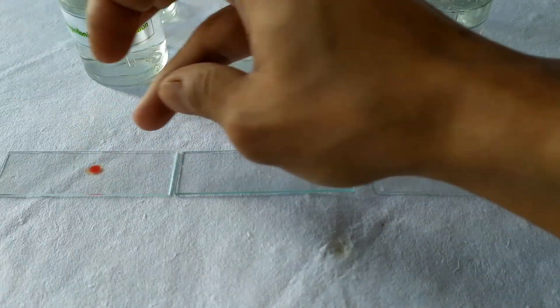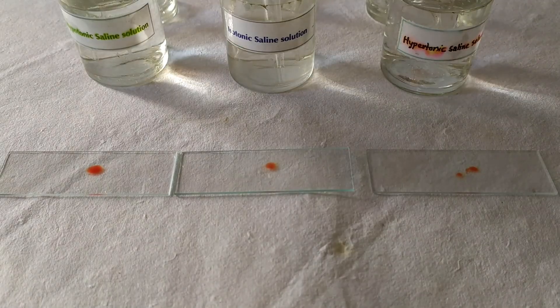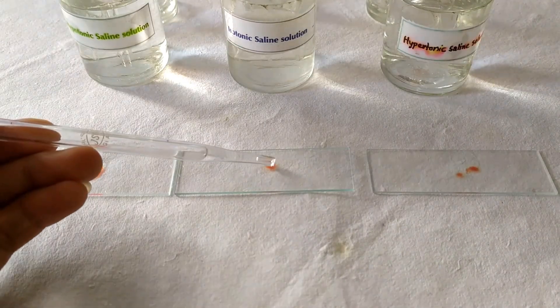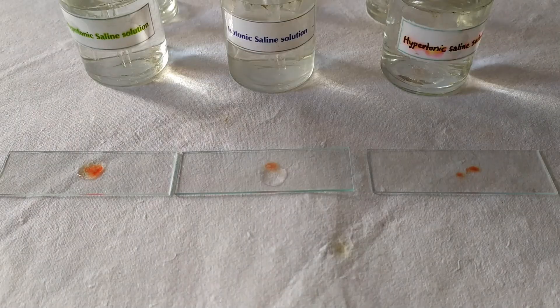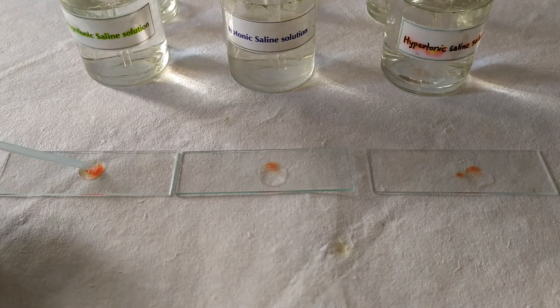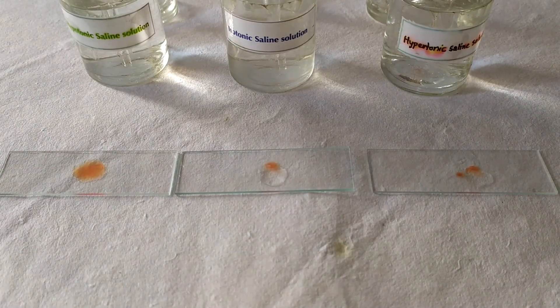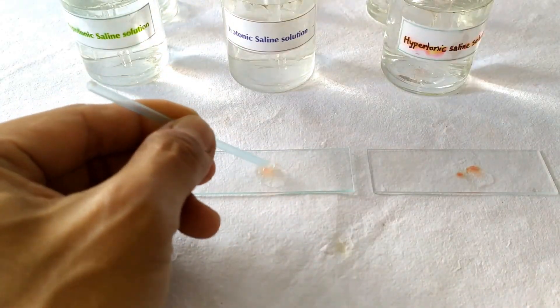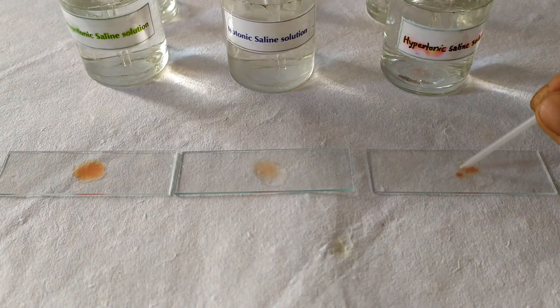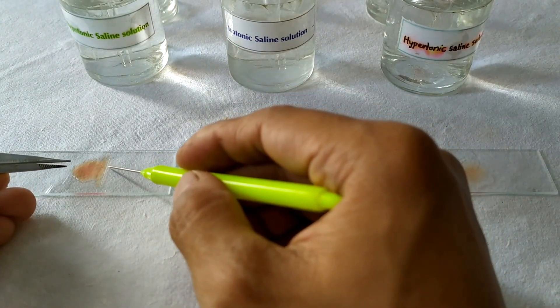Place a drop of blood in the center of each slide. Then place a drop of hypotonic, isotonic, and hypertonic solution on the drops of blood in each of the three slides. Mix each drop of blood with the tonic solution using three different mixing sticks or toothpicks. Cover them one by one using cover slips.